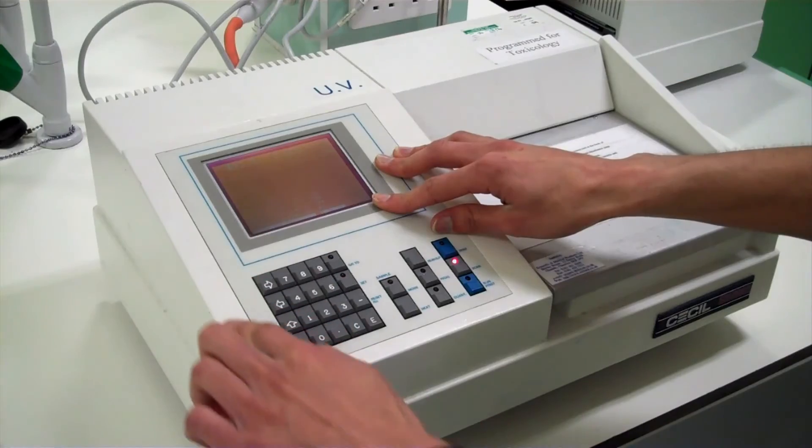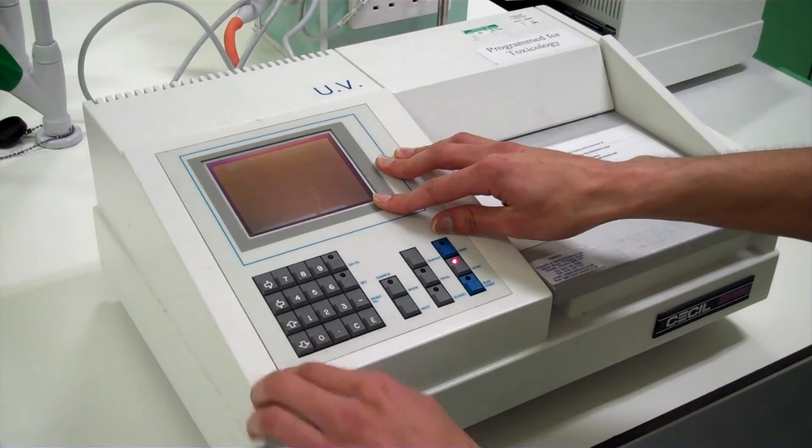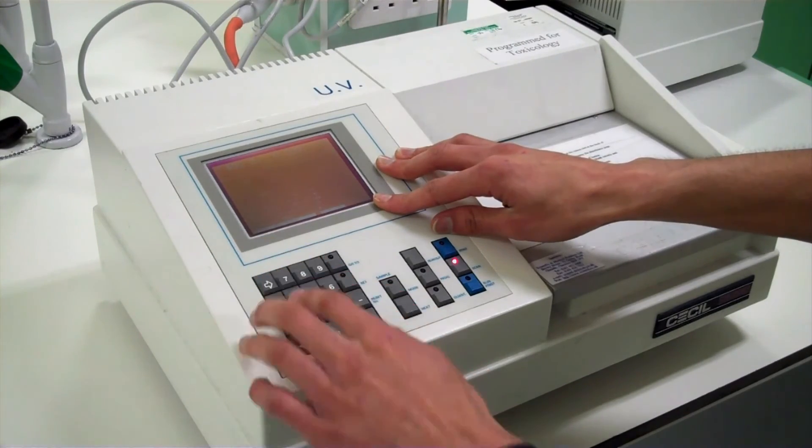Y axis, our minimum absorbance will be zero. Enter. And the maximum will be 1.5. Enter.